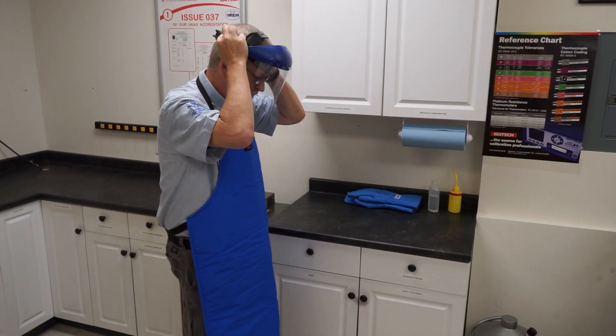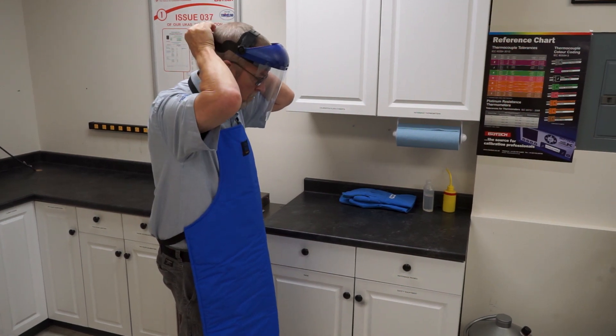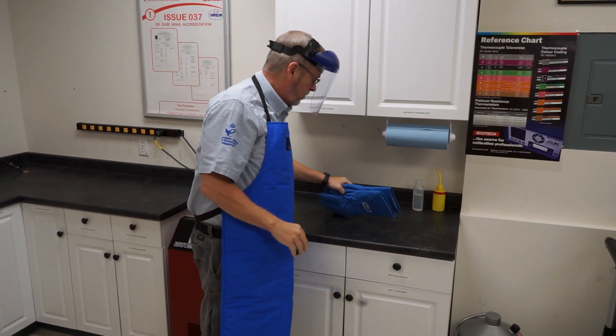Before pouring liquid nitrogen, it is important to equip yourself with protective gear to minimize the chance that you get a cold burn.